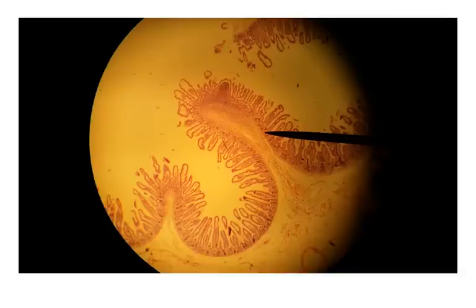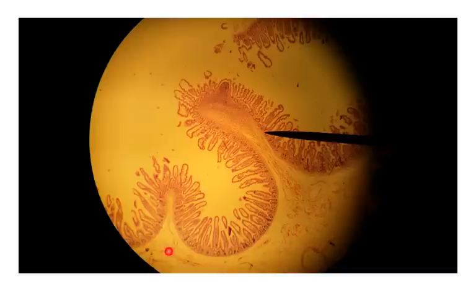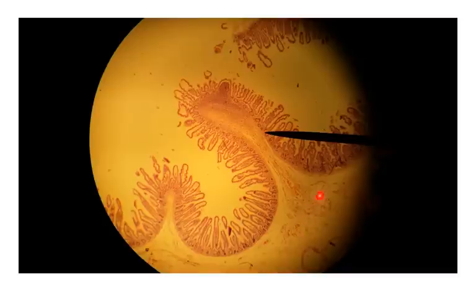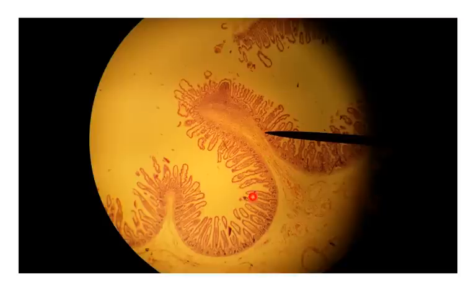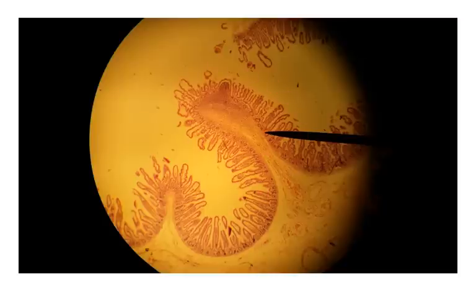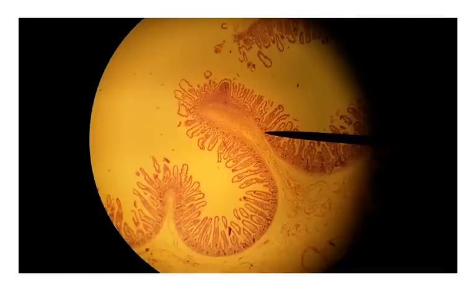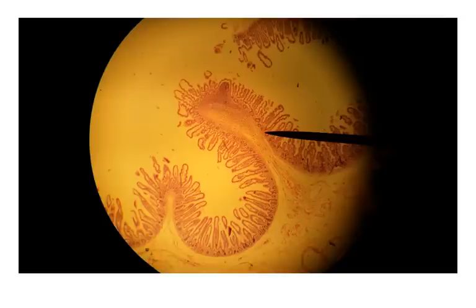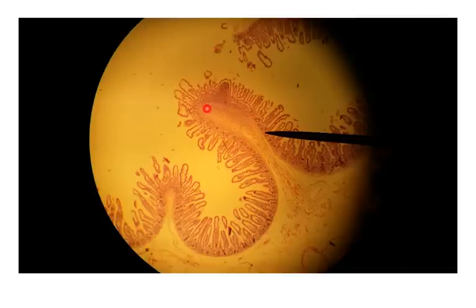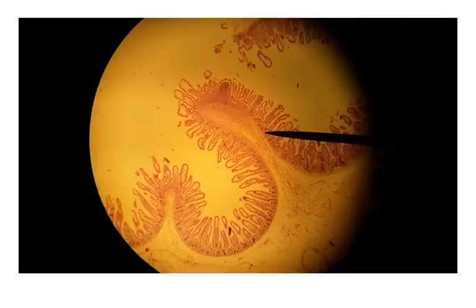Now we're on the innermost area of the intestines. We can still see that submucosa from the previous slide, extending up into this finger-like projection right here. This projection is called a plicae circularis — one is a plicae circularis, multiple are plicae circulares. The submucosa extends up into that plicae circularis, and at the tip is some darker staining tissue — this is lymphatic tissue called a Peyer's patch.